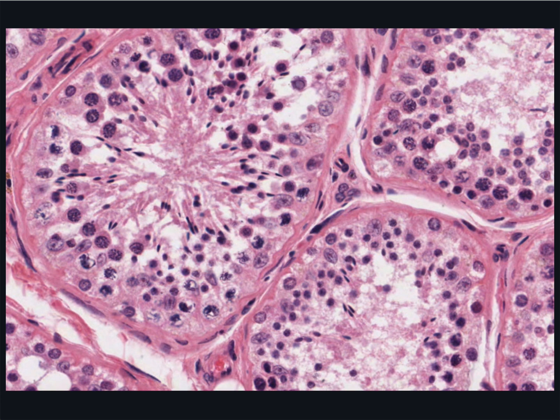Secondary spermatocytes have half the volume of primary spermatocytes. They divide soon after being formed. Therefore, you rarely see them at this stage. The best place to look, of course, would be in a region like here that contains primary spermatocytes in division.